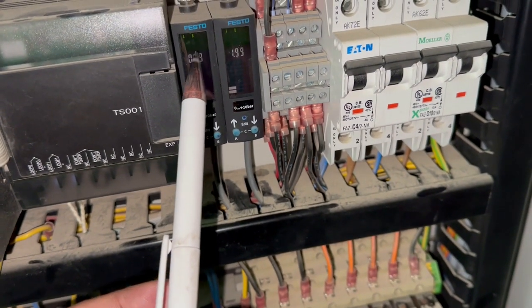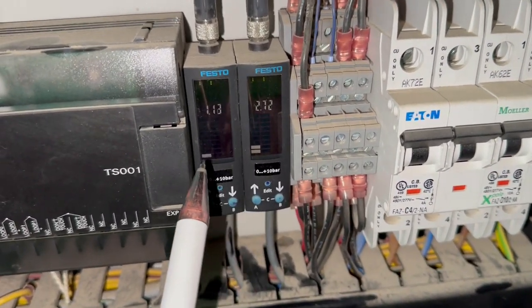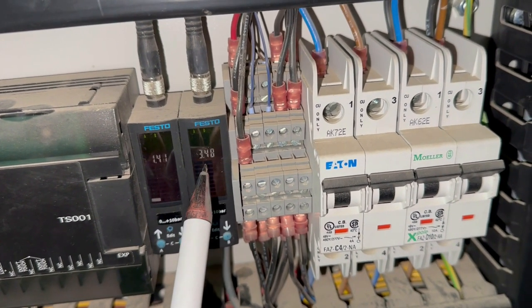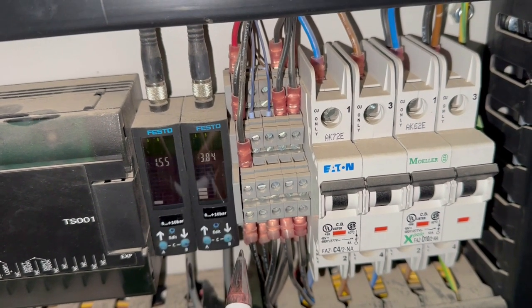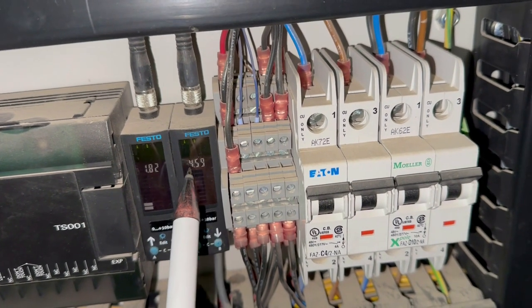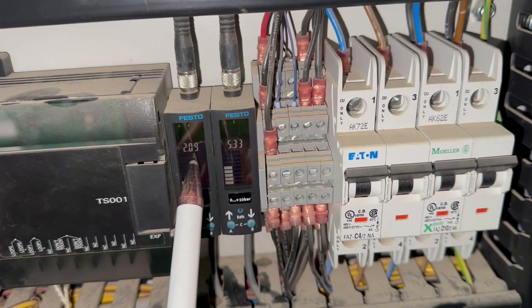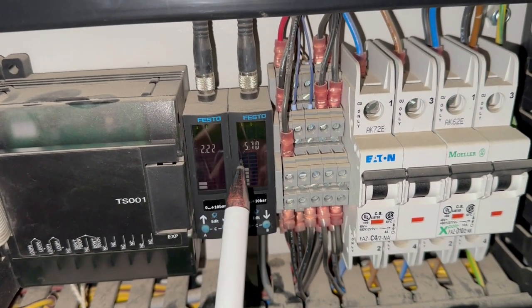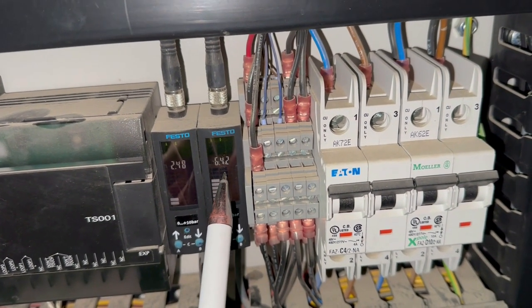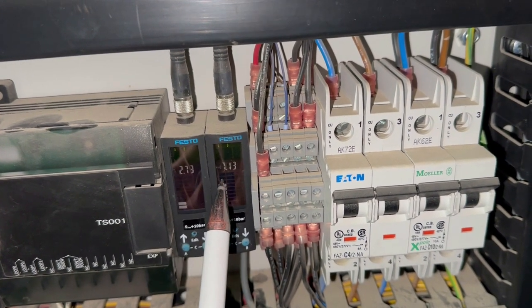So here you can see both pressures are rising, the pressure for the nitrogen and the pressure for the air. One thing which is important for understanding is, since in the path of nitrogen we have a membrane, and we have only one source, from the air we are extracting the nitrogen. So here you can see this is the air and this is nitrogen. It seems that it's working fine, because the pressure building rate in this chamber is less. It should be, because this is filtered nitrogen, which is our final product, and this is air. So yes, we are creating the pressure inside the nitrogen tank with nitrogen, and this is the pressure for air.